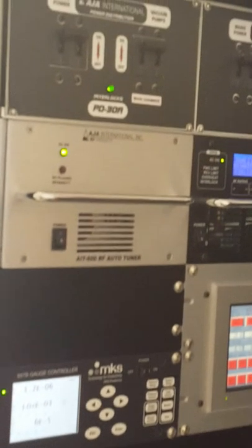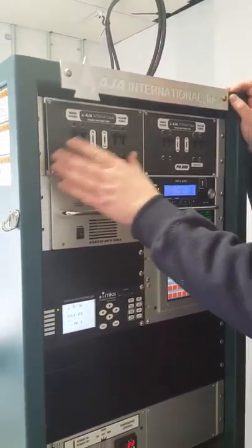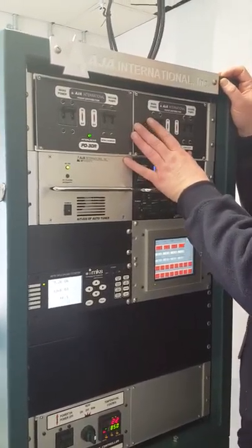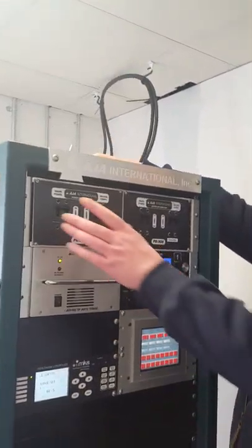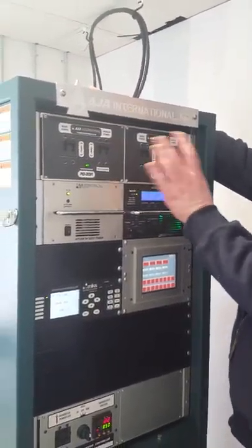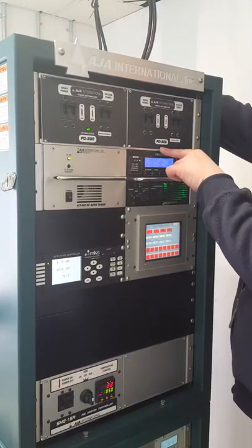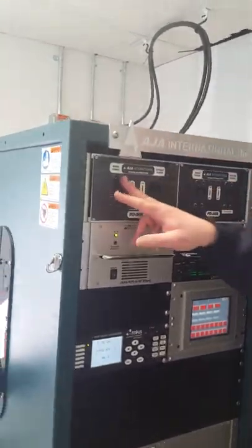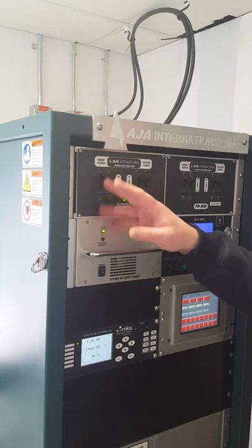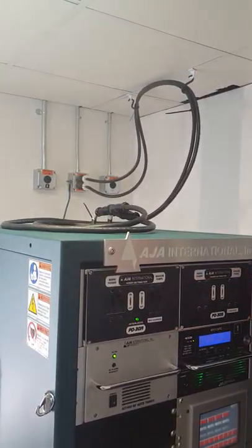Let's talk about some of these other things here. We have our mains power distribution boxes. There's a single-phase 208V power feed going into the back of each of these boxes independently — single phase 208V, rated for 30 amps in each box. Each has its own mains power switch to distribute power throughout each individual box.